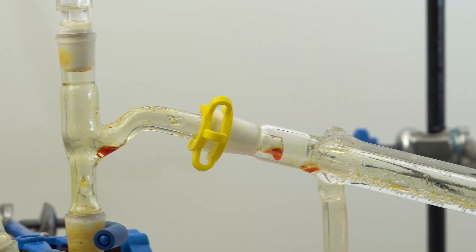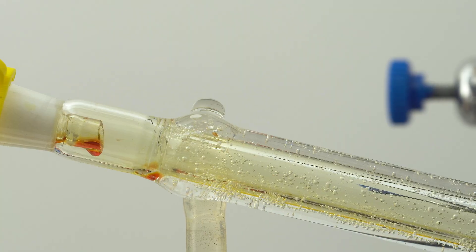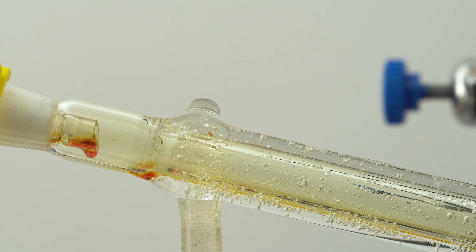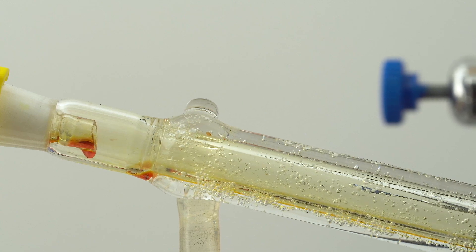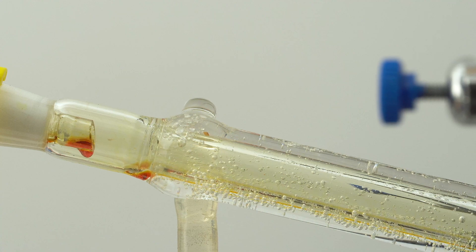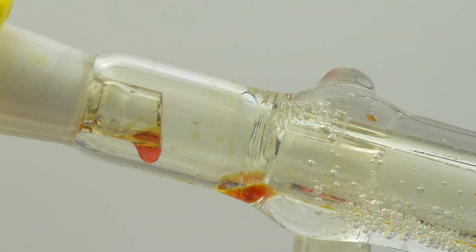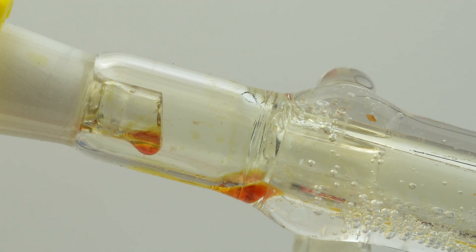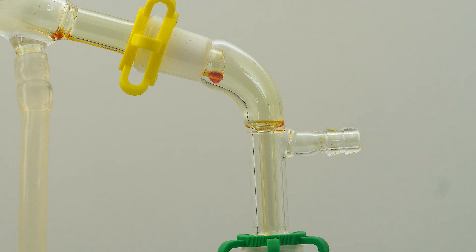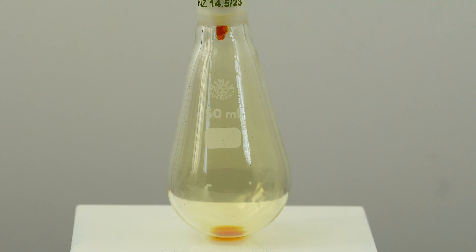Chlorine reacts very easily and quickly with sulfur vapor, and we can observe the fairly rapid formation of dark red drops. This is disulfur dichloride with an admixture of sulfur dichloride. The disulfur dichloride we need is an oily liquid of a yellowish-orange color, which is formed after distillation of the red liquid we initially obtained. Sulfur dichloride easily decomposes into disulfur dichloride and chlorine when the temperature increases.